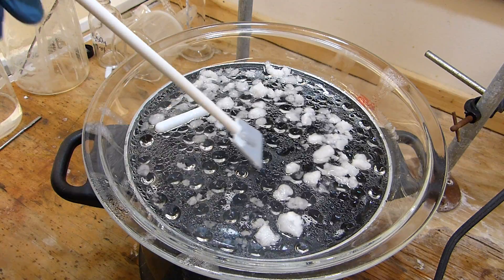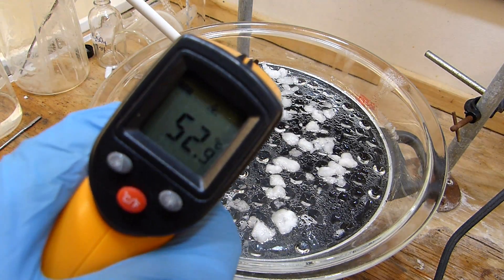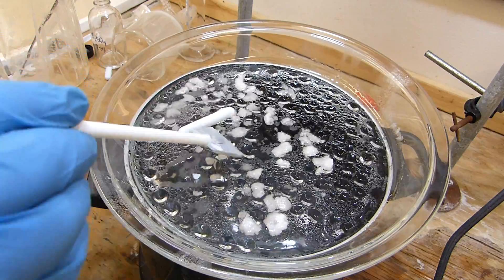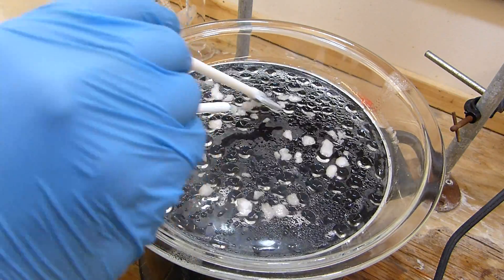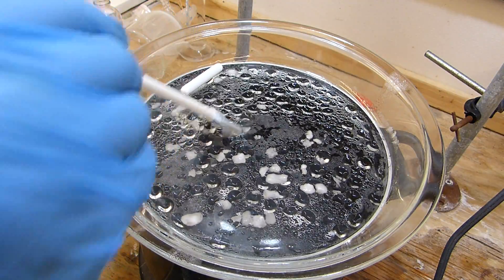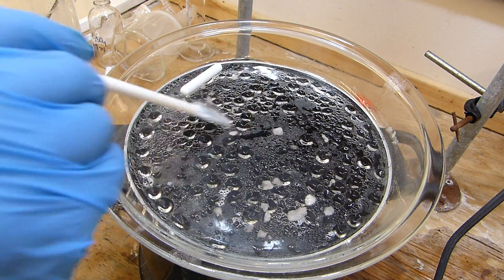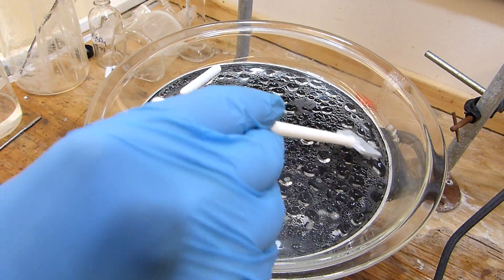And you can see the product is readily melting at about 50 degrees Celsius. We can verify that with the thermometer — it's 52 degrees. For oxalic acid it would be much, much higher than that, so that's a very good indication that this is the fairly pure ester. I'm just going to heat this a little bit more until it completely melts, and then maybe hold it as a liquid for about five minutes, just to make sure we're driving off water and other impurities. Then I'll go ahead and let it cool on the plate and we can scrape it up and store it.